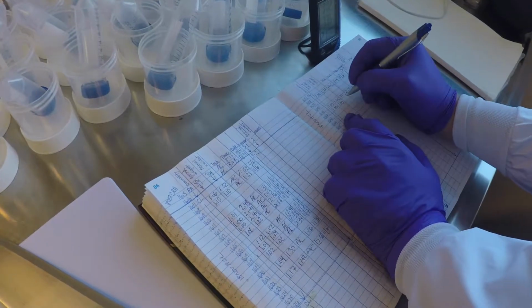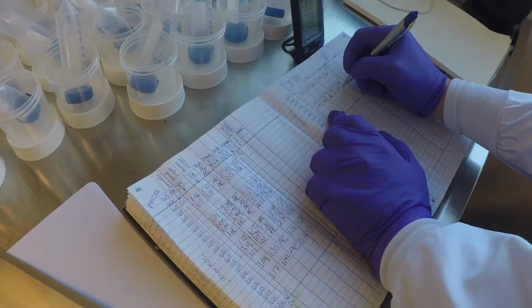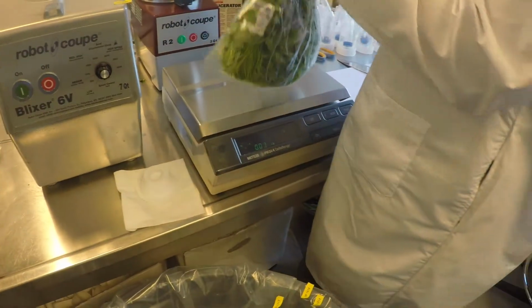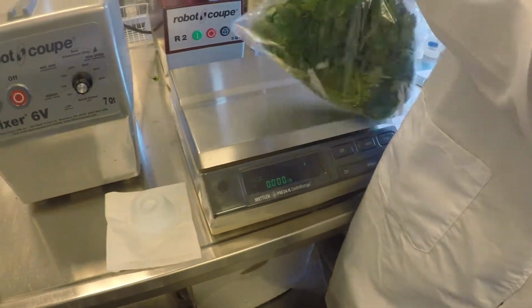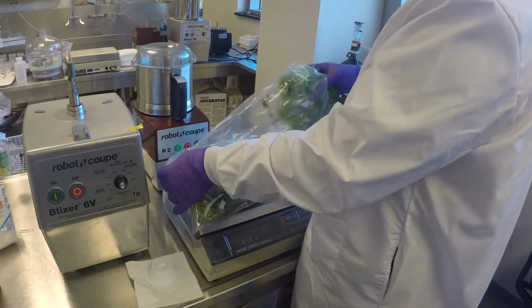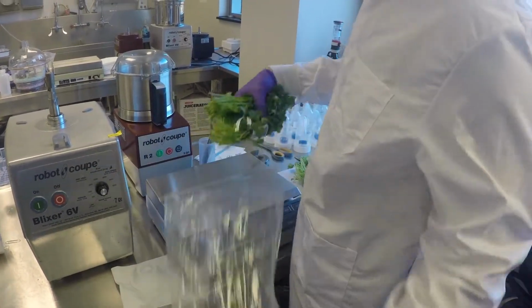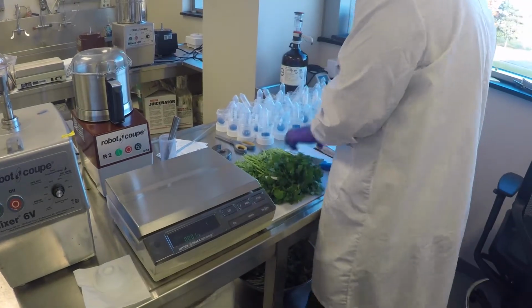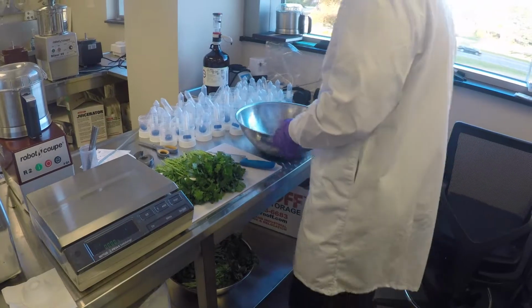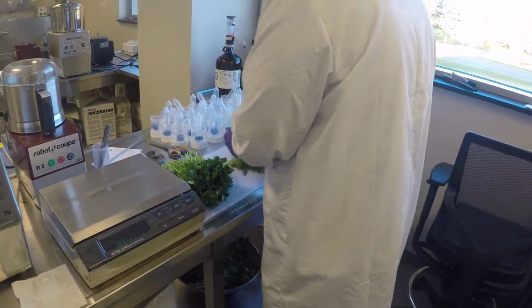Fruit and vegetable sample information shall be logged in a logbook. It should include the New York State Lab ID, commodity sampled, the sample set identification, the weight of the entire sample, the weight of the sample ground, if different from the entire weight, initials of the person that prepared the sample, the date and the time of the preparation, the location of the stored homogenized sample, and the date of the retained sample disposal, and initials of the person who dumped the sample.